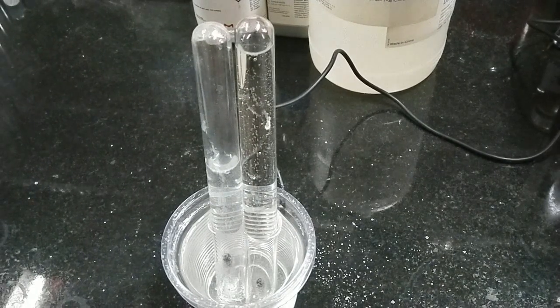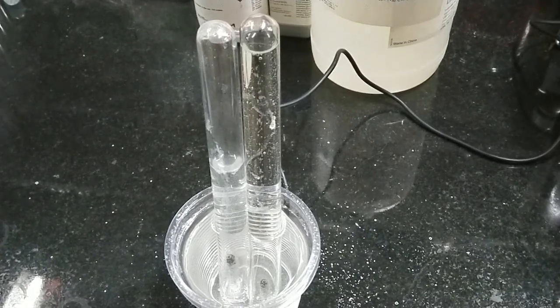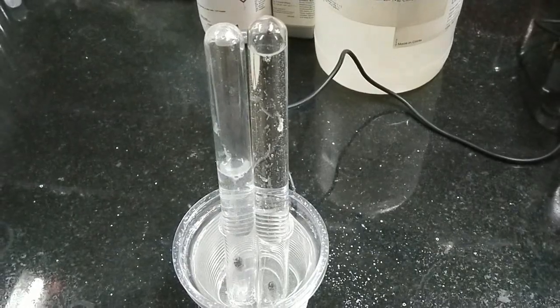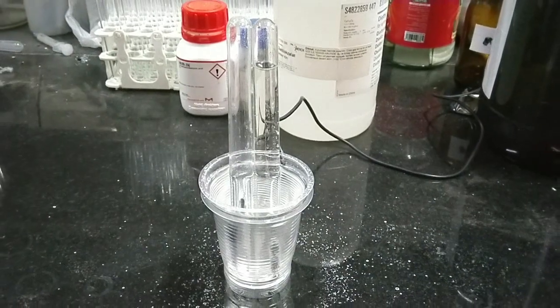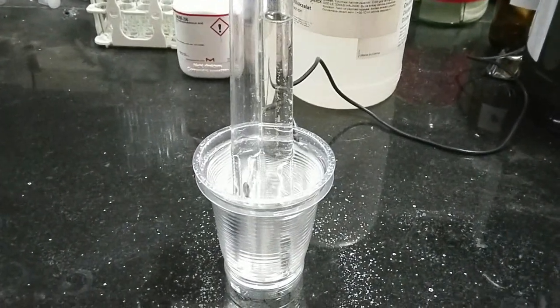As the reaction continues, the amount of hydrogen gas is getting more and more than chlorine gas. As you see here, the left test tube is full of hydrogen gas.